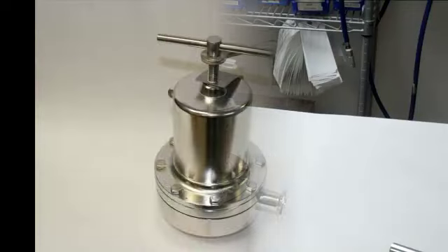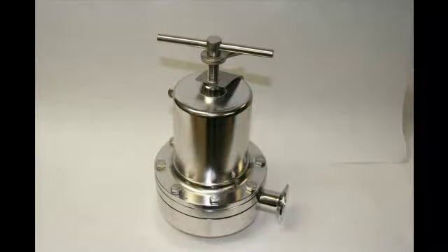This has been a presentation of the assembly of a Mark 96 Steriflow valve from Richards Industries.